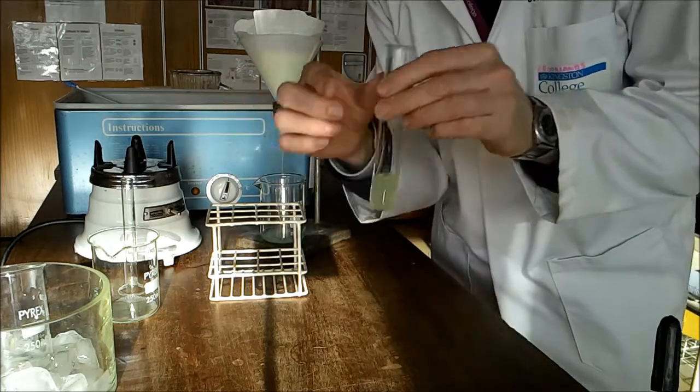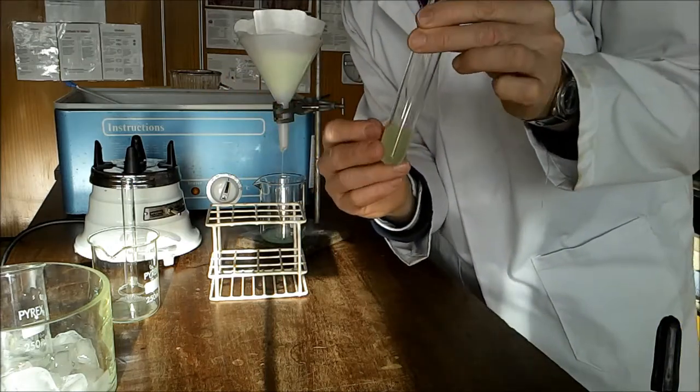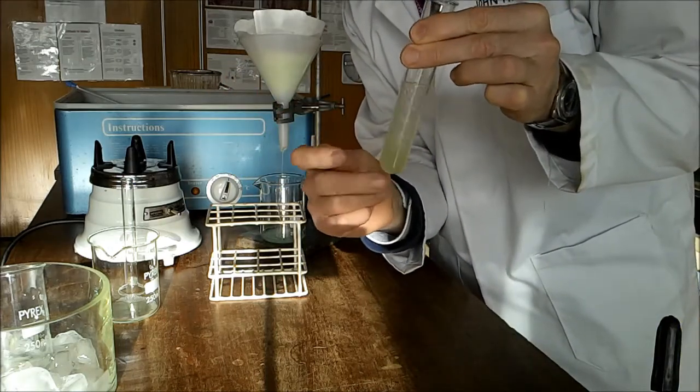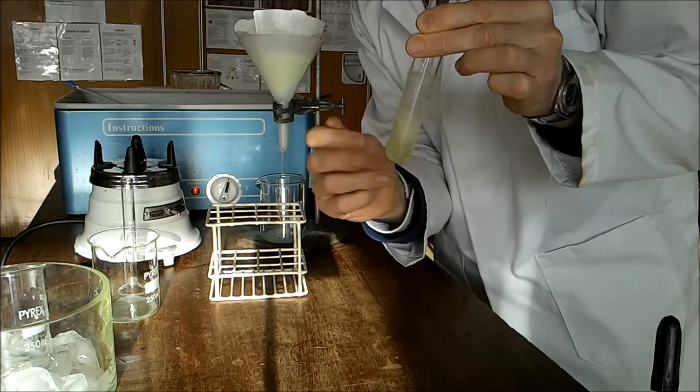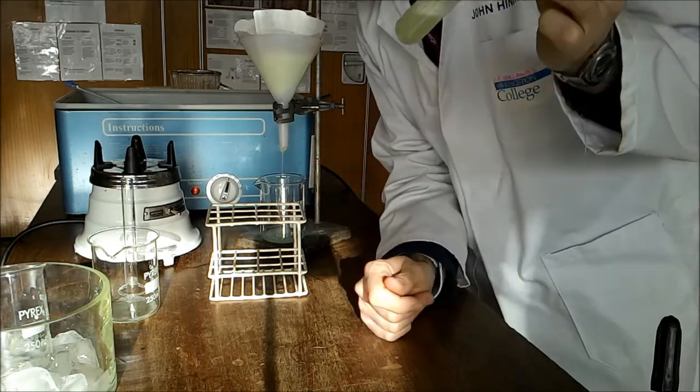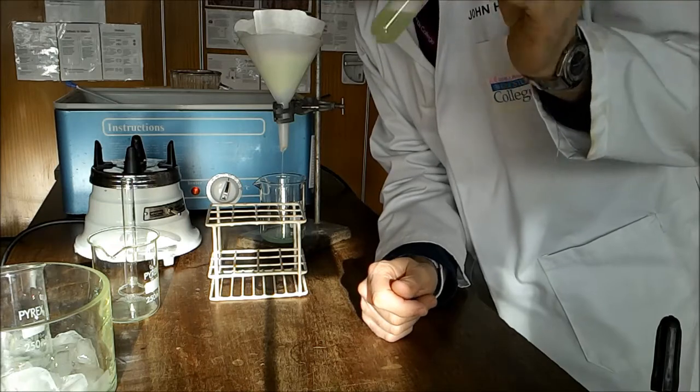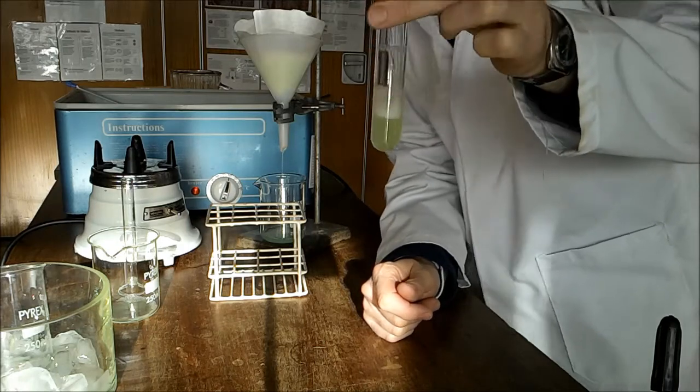In order to mix this, we are going to do a flip mix. It should be nice and even consistency.